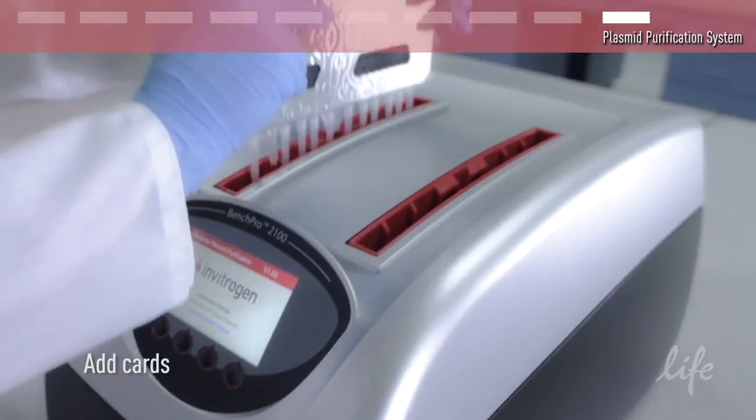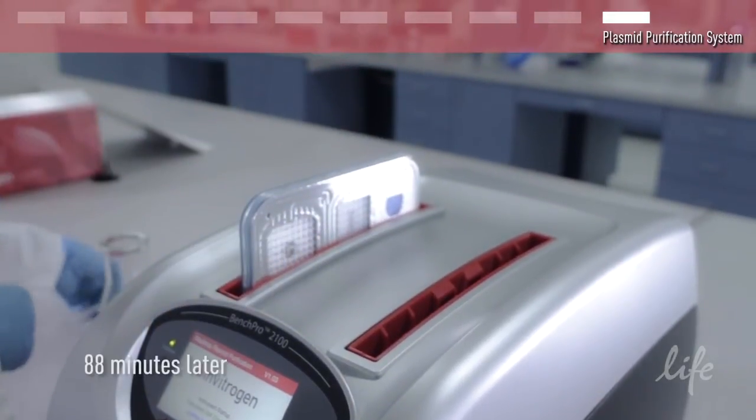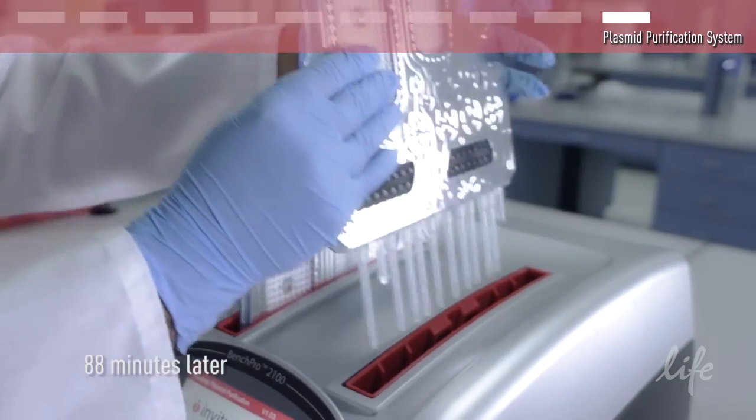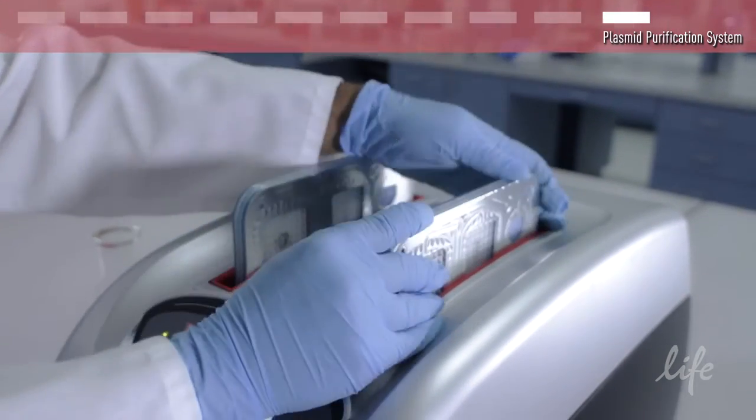Now simply add your card to the slot and press go. 88 minutes later, you have your transfection grade plasmid DNA resuspended in TE buffer.